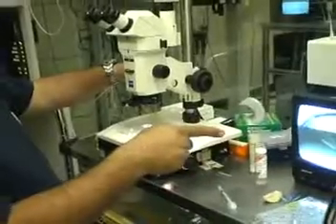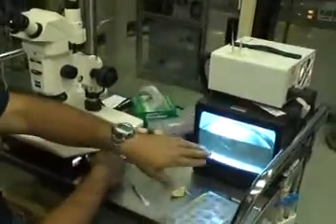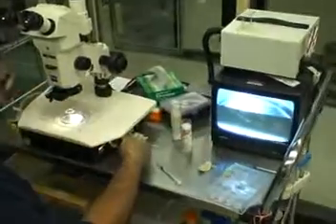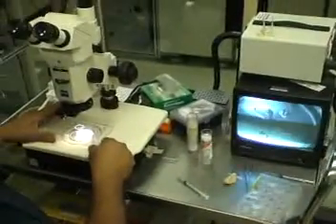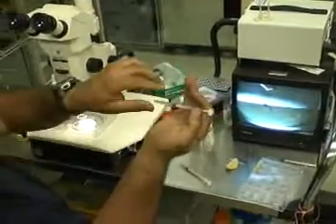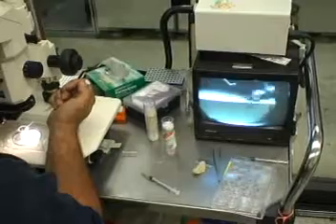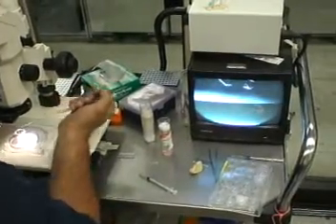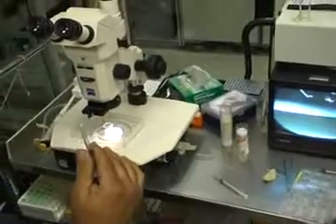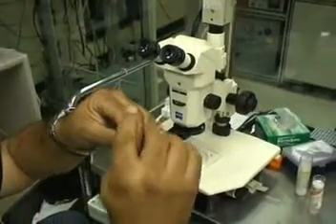Now we're going to fish the crystals. I'm going to try to mount one of these crystals in here — they're not perfect but they're good for the demonstration. I'm going to try to grab either the little one or the big one if they fit. So with my syringe, pre-set about halfway, I'm going to try to mount it. I grabbed the crystal and flipped it over so gravity moves down. Now I have a column of water right here — do you see the column right here?